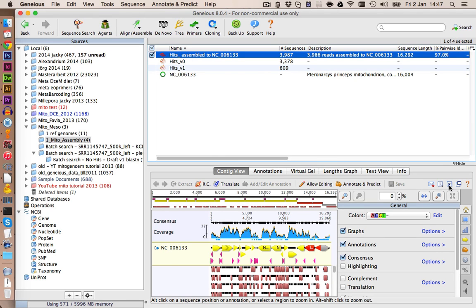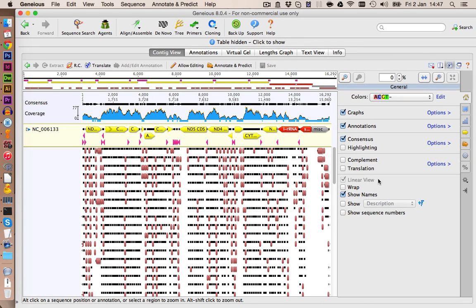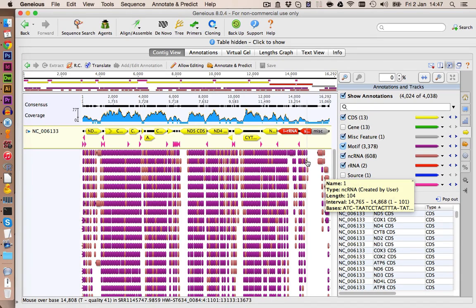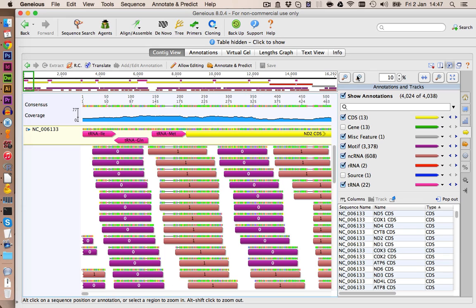Let's take a closer look at the assembly. And I'm also going to go to annotations and activate this one here as well. Let's zoom in a bit.